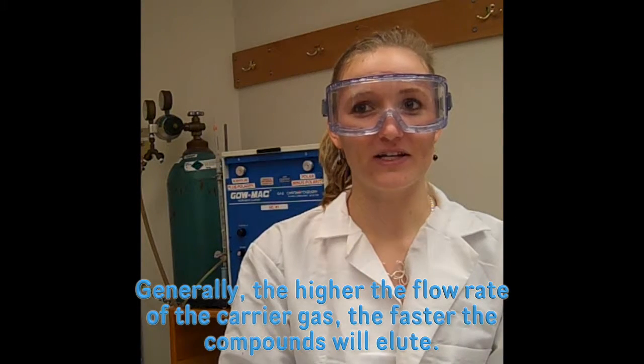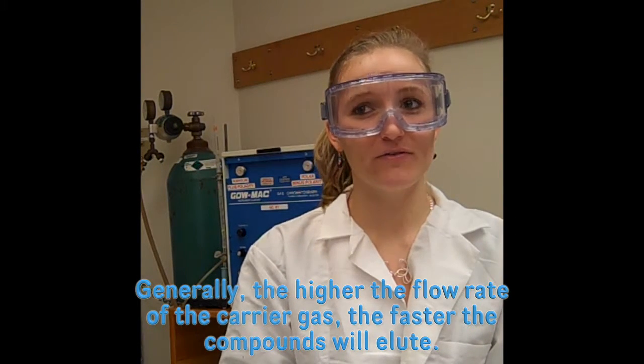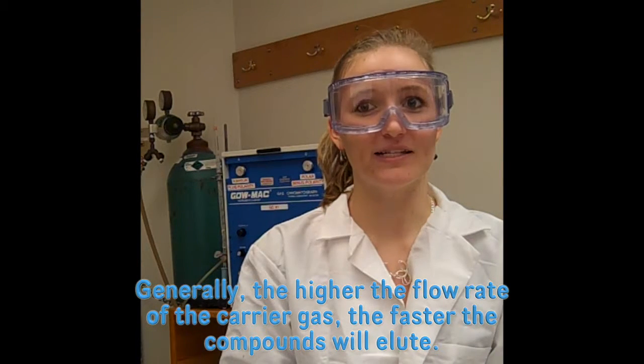Flow rate is another factor that affects elution time. The higher the flow rate, the quicker the compounds are eluted as the carrier gas pushes them through the column. There are many other factors that have an effect on retention time, and each factor does not necessarily affect the compound in the same way or with the same magnitude. Instead, factors are dependent on one another, and some may take precedence over others.